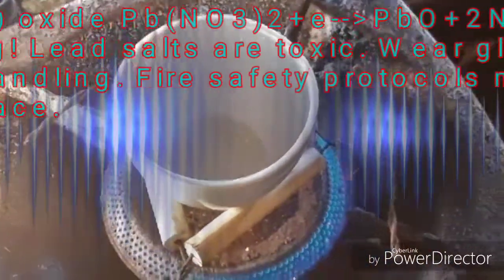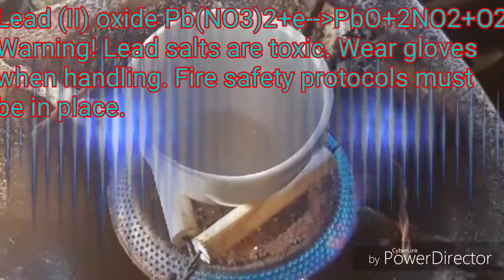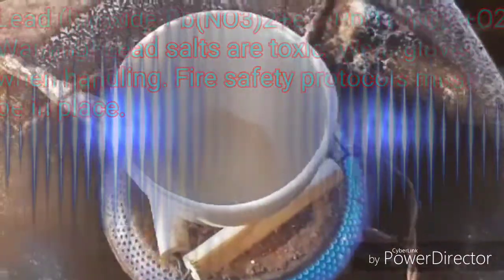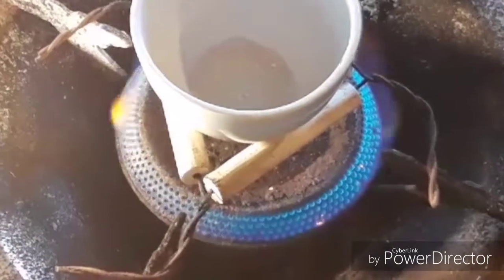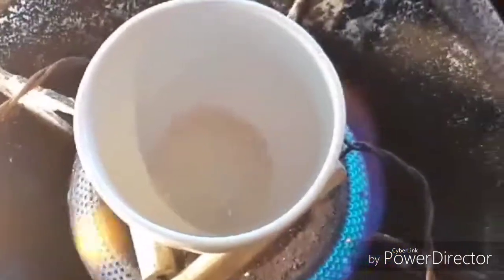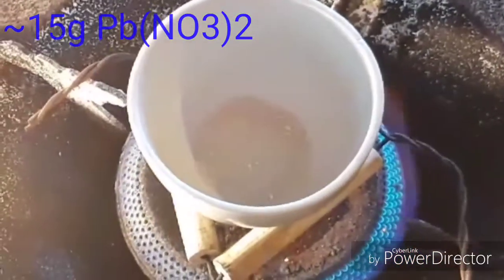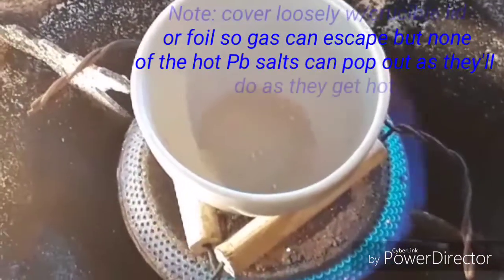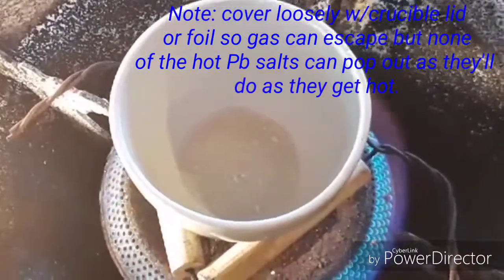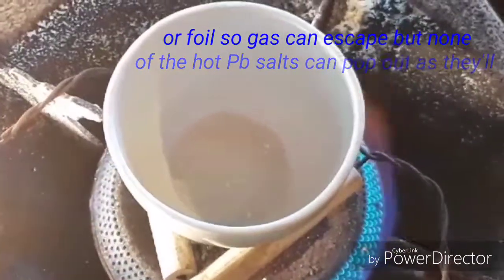Hey internet, welcome back to Chaos Chem. Right now I am doing a very simple experiment — I am making some lead(II) oxide. What you're seeing here is my gas burner set up with clay pipes supporting a little crucible. Inside the crucible I have added some lead nitrate. We just let this go and we will start to see it turn a yellow-orange color, and once all of this has decomposed into the yellow-orange color we have obtained our target product of lead oxide.